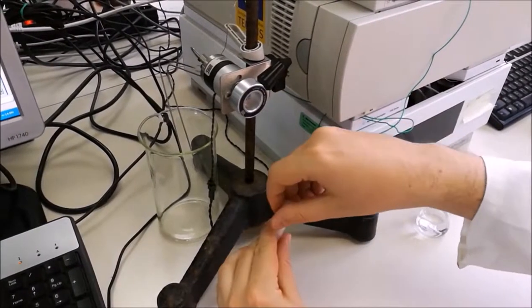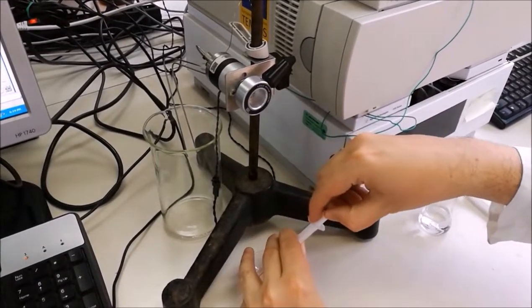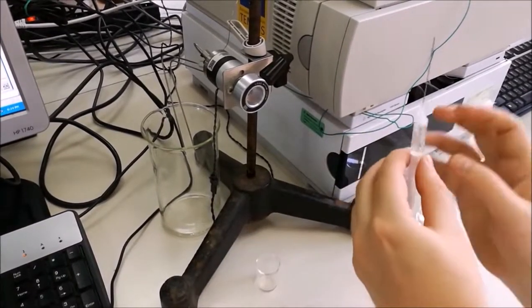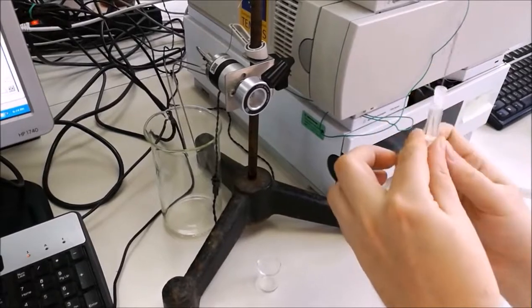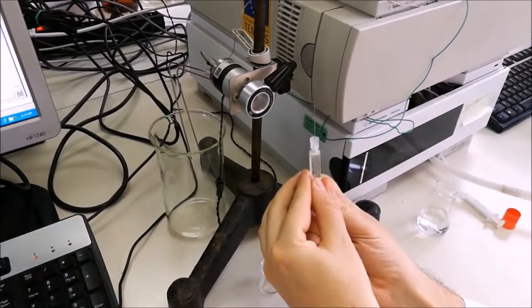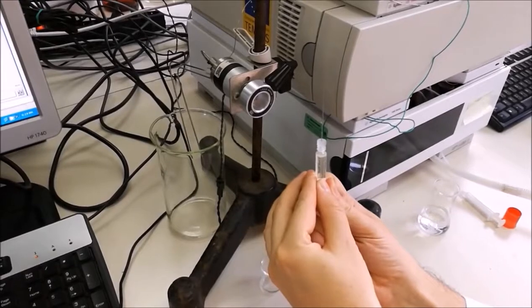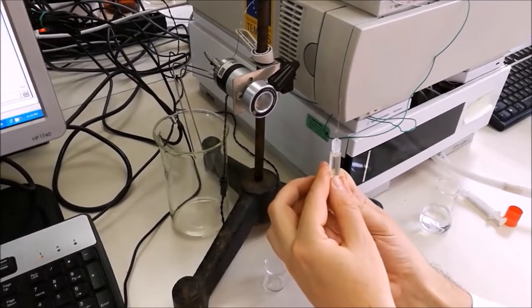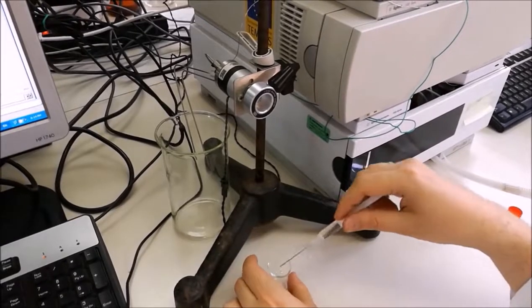Now using the syringe, we draw in some sample. We need to make sure that there is no air in the syringe.